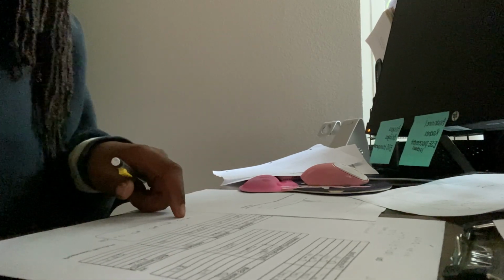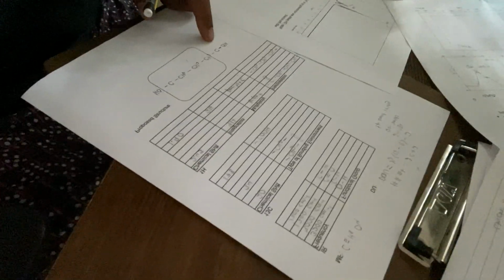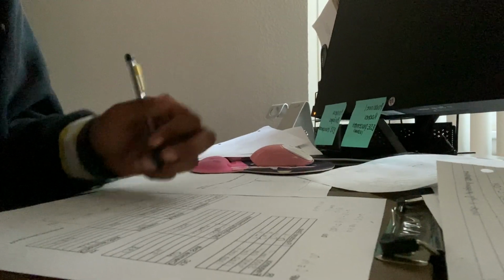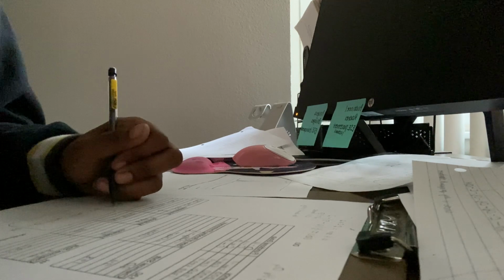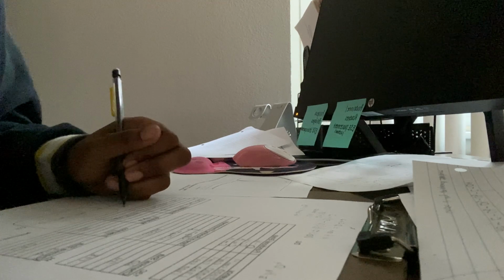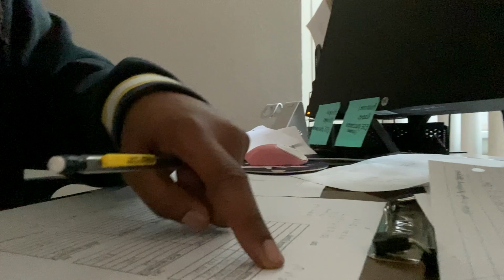This is looking more, just to give you guys a view, like the structure that we're supposed to have. But I'm still missing my double bonds. I know that there has to be double bonds, and I know I'm missing oxygen. So, missing 2 oxygens because I have 2 right here, and it's 4 in total here. So I double bond that to the carbon, and I double bond that to the carbon. Everything for my molecular formula, unfortunately my recording stopped, but I'll piece them together. So, this is my final proposed structure.